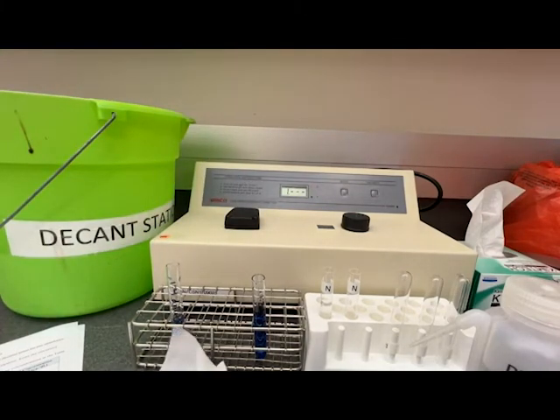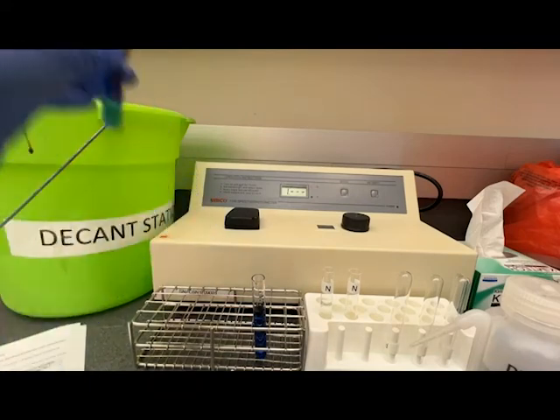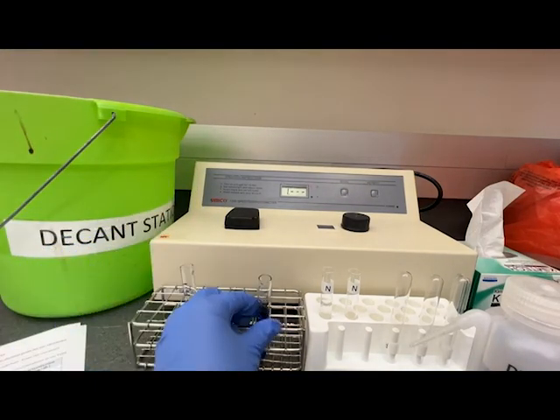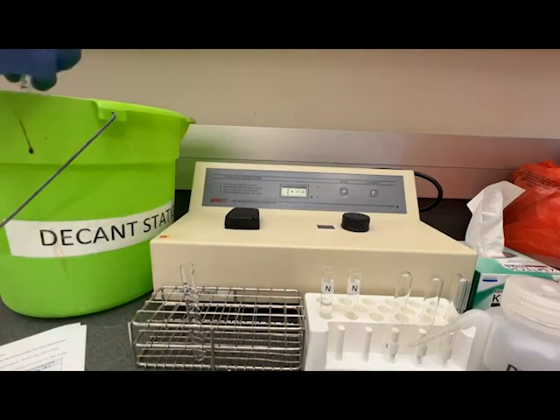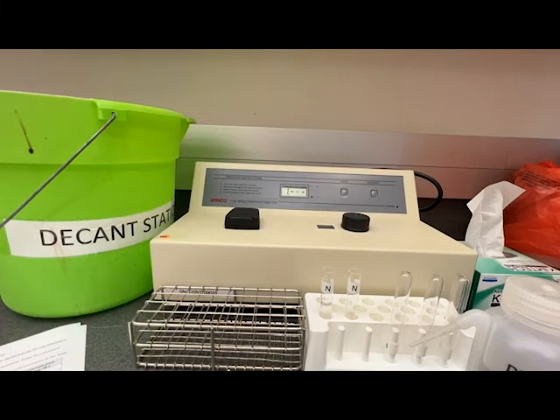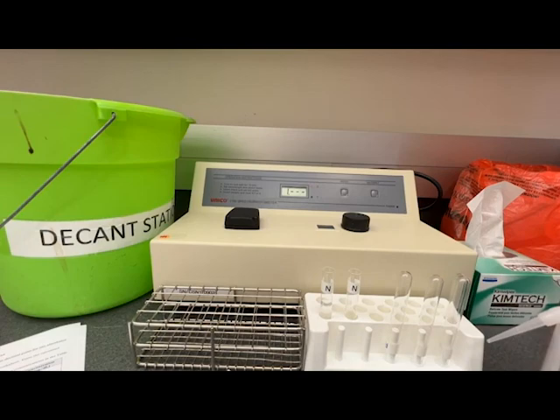When we're done and we've checked our values and done our calculations, if everything looks good we can then decant our solutions into the waste bucket. The cuvettes do not get thrown away and instead they are cleaned and used again.